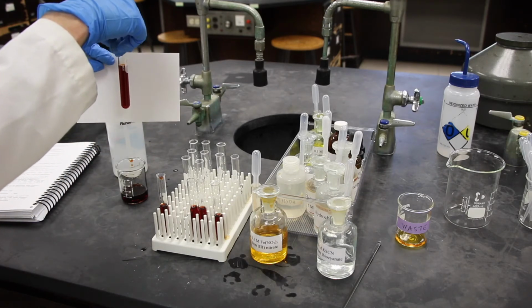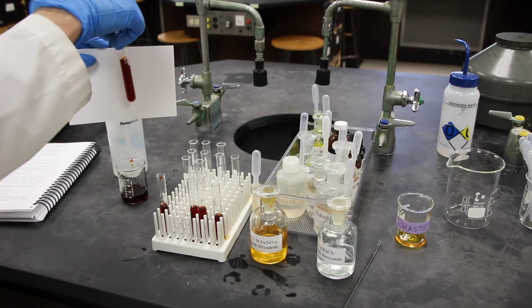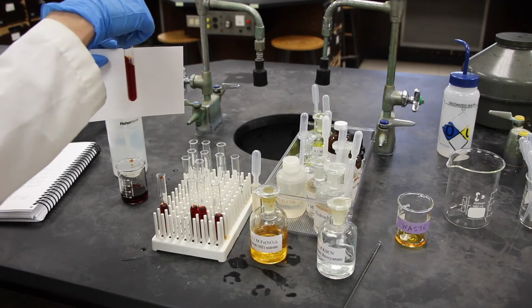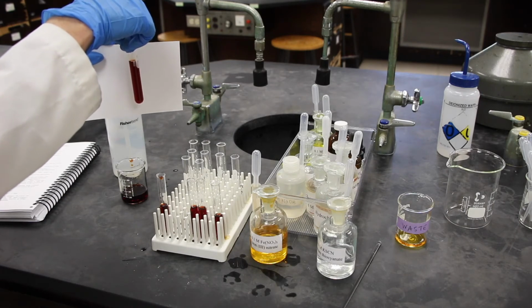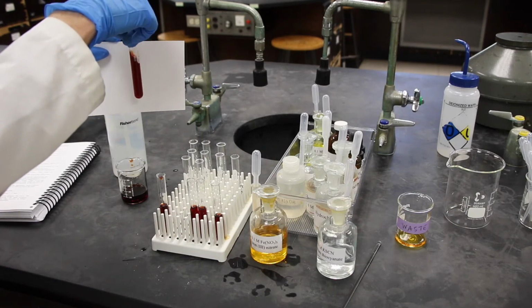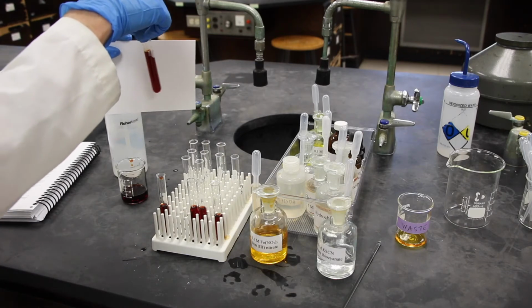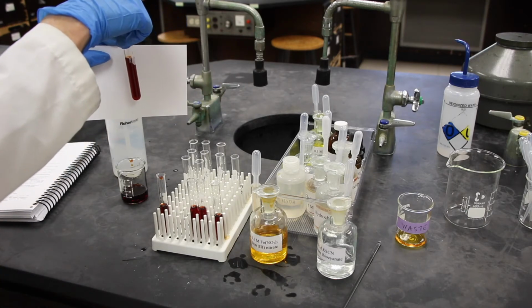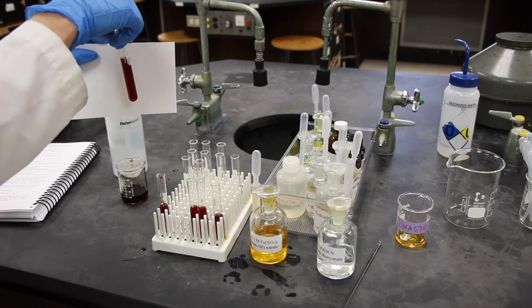What is the stress on the system? Again, you've added iron nitrate, Fe3 plus and NO3 minus, those two ions. You're going to ask yourself, do I see either one of those in the balanced net ionic equation? And if you do, then you're able to write what happened to your equilibrium. If you don't, ask yourself, is it reacting with one of those species? Okay, you can answer the questions from looking at this test tube.